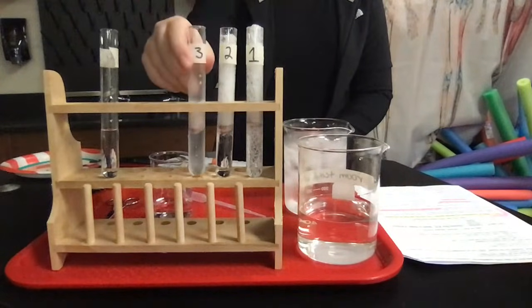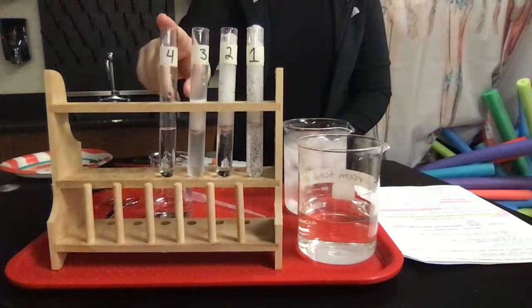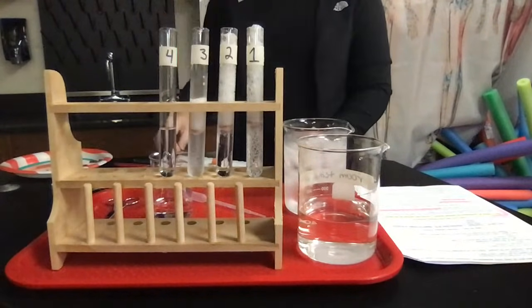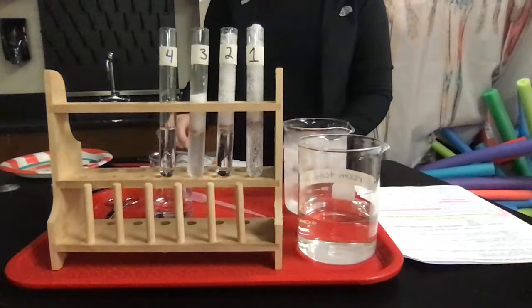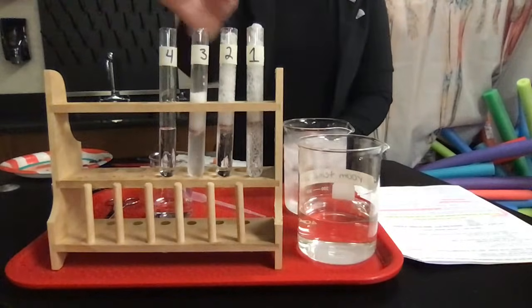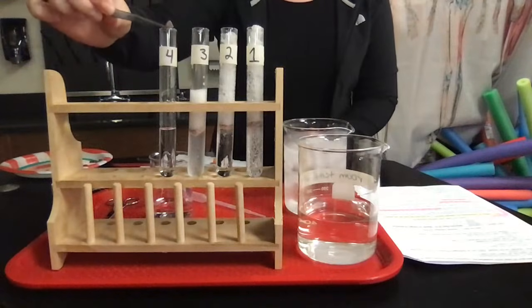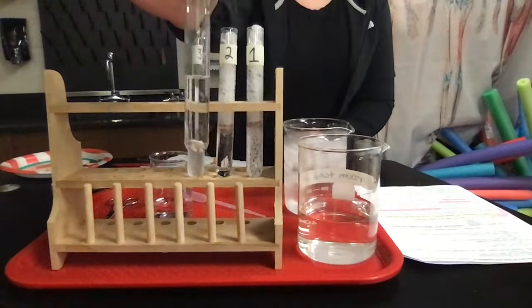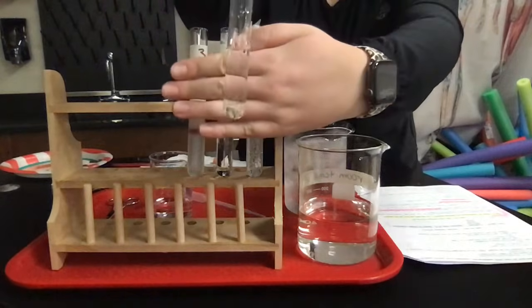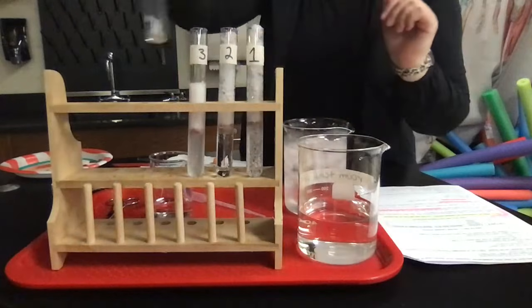And now test tube 4, the hydrogen peroxide is room temperature. However, the liver was boiled at 100 degrees. I'm just going to rinse these off real quick. At 100 degrees Celsius. So now it looks a little bit cooked. So we're going to put that into test tube 4. And here's the reaction rate. You can see that for test tube 4. So you're comparing the differences here.